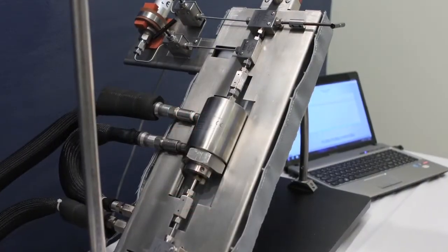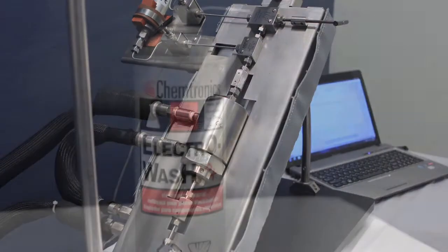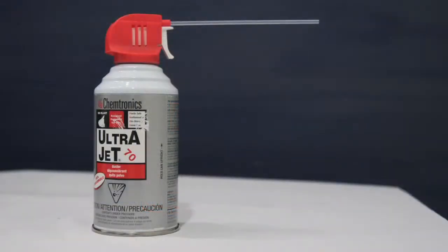Before beginning this procedure, make sure that all samples are cleaned with the appropriate solvents and dried with air or nitrogen.